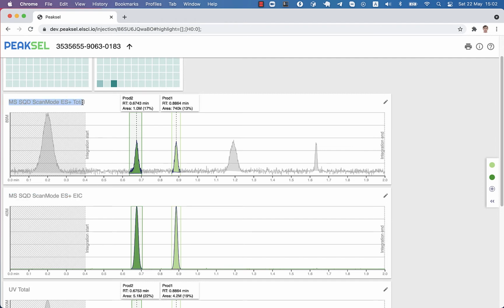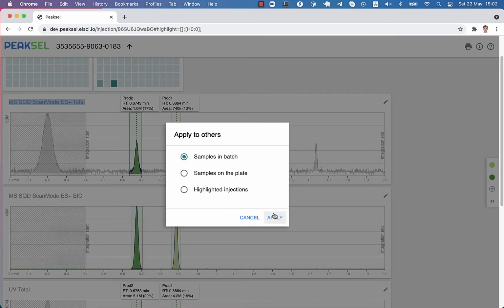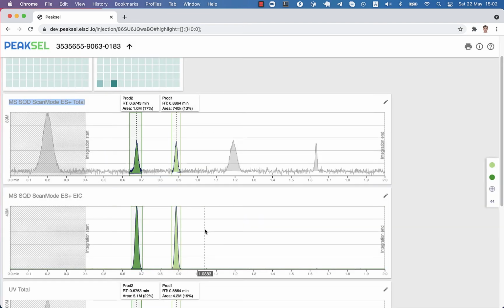If we were to change the settings for another chromatogram, we could apply them globally as well, and this is how you can set it all up for the whole batch. But what about injections that you will create tomorrow? If you use the same LCMS method and the same instrument, then most likely you'll want to reuse the same integration parameters. So how do we tell Peaksel to do this automatically?